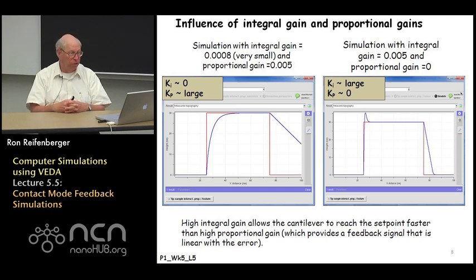the AFM produces. On the other hand, if you set the proportional gain equal to 0 and you make the integral gain 0.005, which is a rather large value in this example, you can see that now the feature that the AFM produces tracks more closely the actual geometry that we specified. You miss a little bit on the leading edge, you always get that overshoot. That's a generic feature of any AFM image. Unless your feedback is adjusted very well, you tend to have a little bit of overshoot on that leading edge.